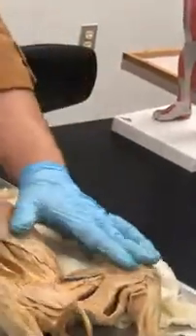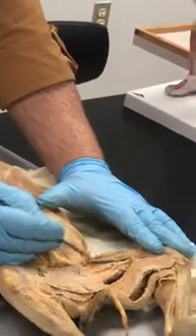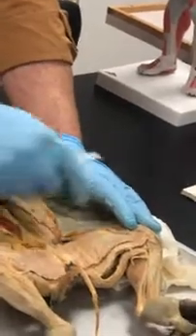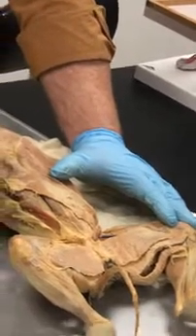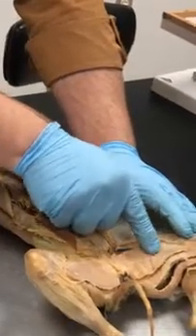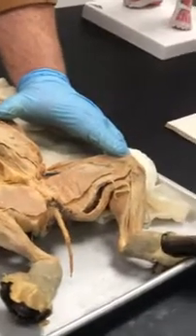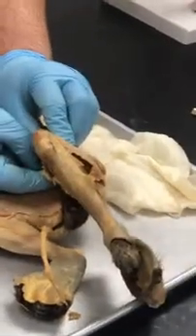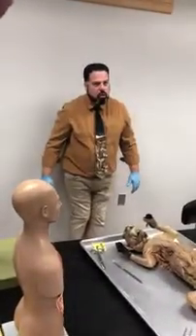Now, this is the one I always get mixed up with. These two muscles over here. Okay? Now, let me ask you this. Here's the gracilis. If I put this over here, what is the action of the gracilis? Remember, muscles pull. So when this shortens and pulls, what is it going to do to the upper thigh, or the thigh? Go ahead. Adduction. Adduction, right? When this shortens, it's going to bring it this way. Okay? So it's going to do this kind of thing, right? It's going to bring it that way. Okay?